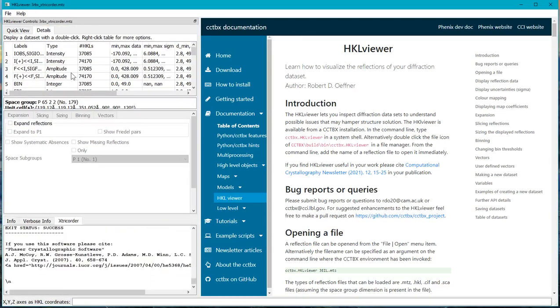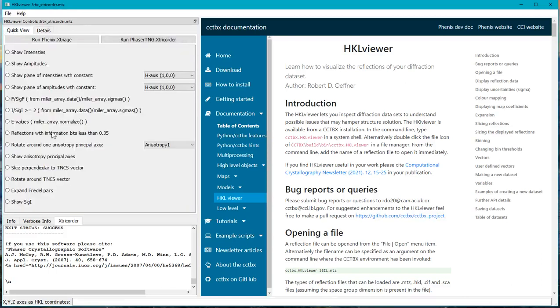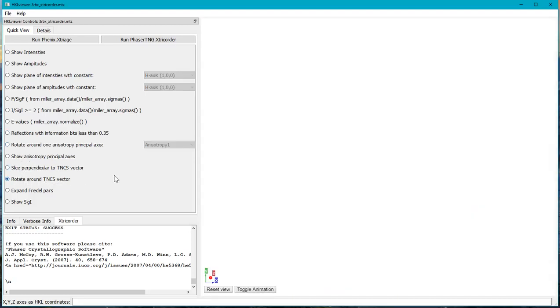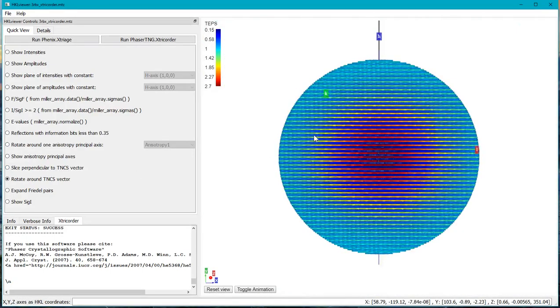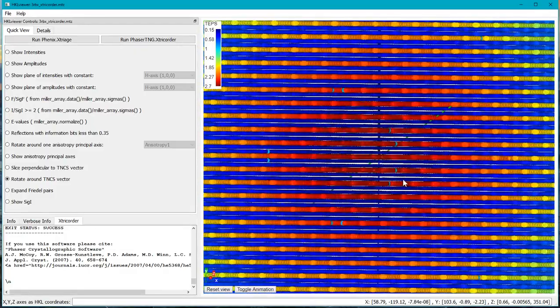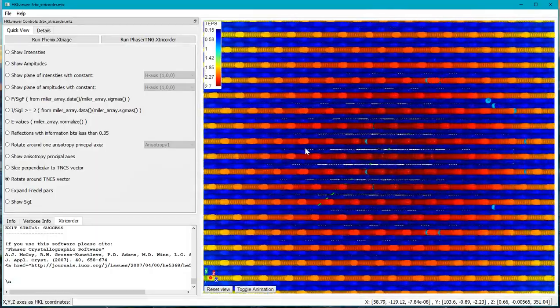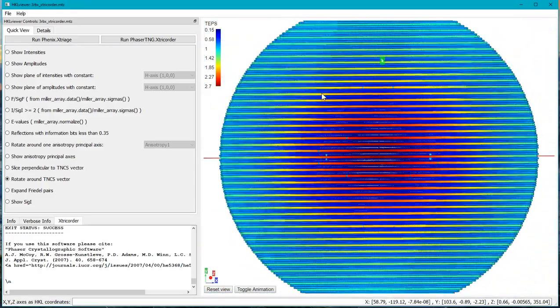And once it's done, HKLviewer will load a new file with new datasets produced by Xtricorder, where the most interesting datasets are the TNCS and the anisotropy correction terms. If we go back to the Quick View tab, we have these new buttons, and we can try and rotate around the TNCS vector to display the data, how it will look with the TNCS correction terms. So we can see there's very strong modulation here in the data, so every third layer the data is quite strong, and the two middle layers it's relatively weak.